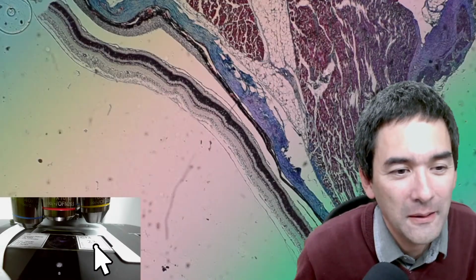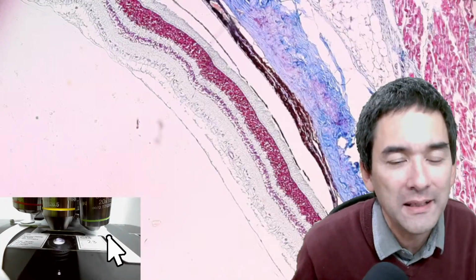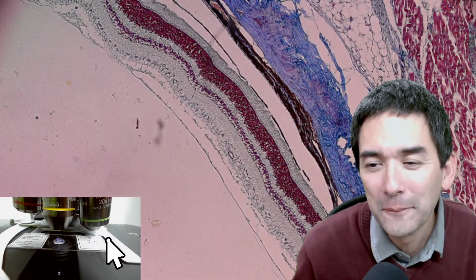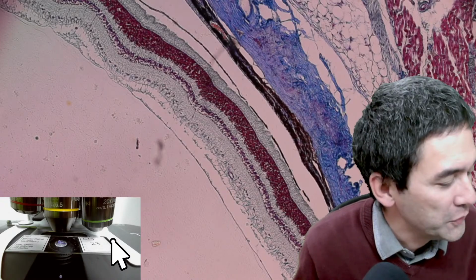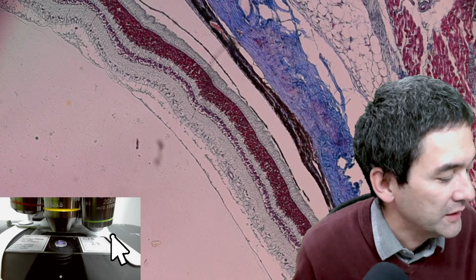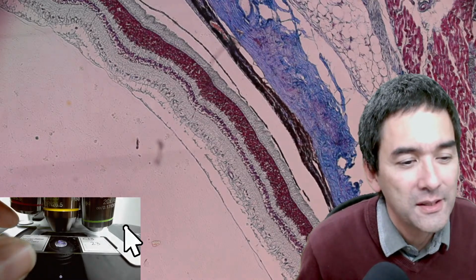But if I leave it out and go up with the magnification, then it's not quite as bright. So I have to swing it back in again, and then it bundles light better. So well observed. When I first got the microscope, I was a little bit confused. And then I was told that you can swing out the condenser and then you get the full view with the low power. I think this has some kind of mechanical or technical reasons. So what is next?